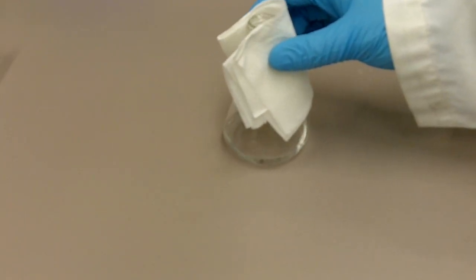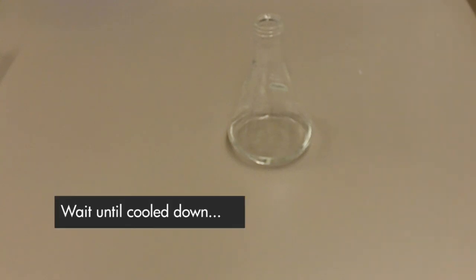You want to carefully remove the flask from the microwave. It's going to be really hot right now so what you want to do is cool it down at room temperature till it's cool to the touch.